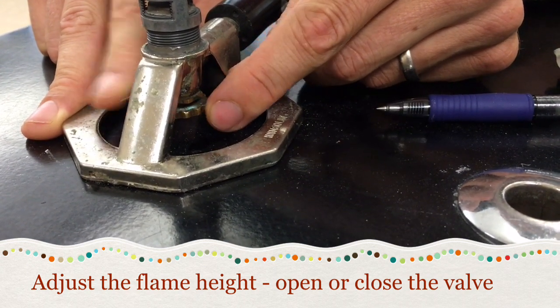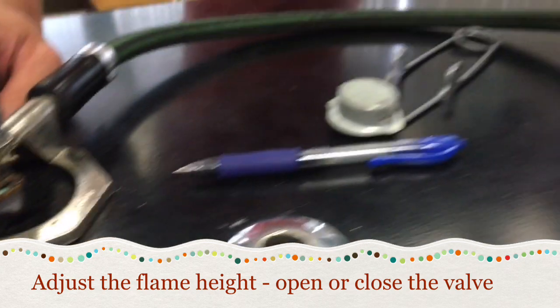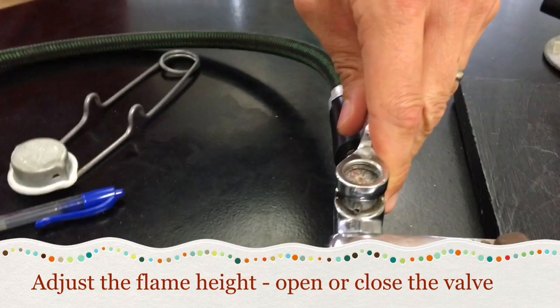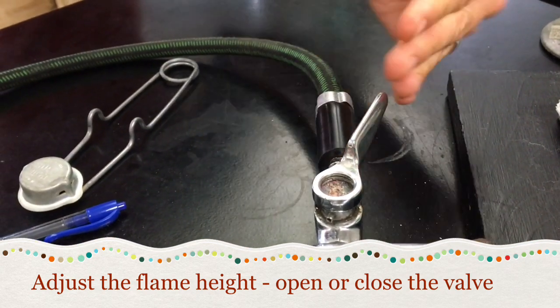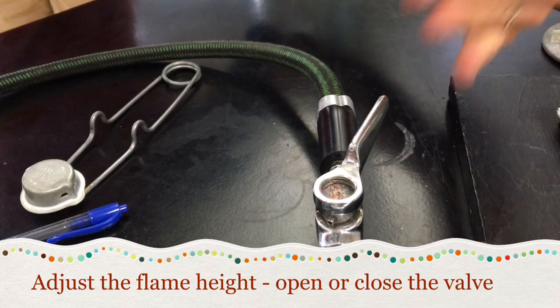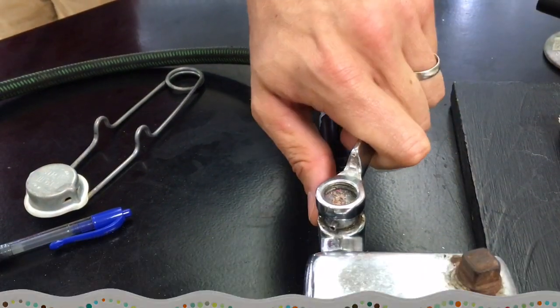One other trick for adjusting the gas is moving the actual master valve — the gas coming in. If I close it a little bit, it also adjusts the gas flow.